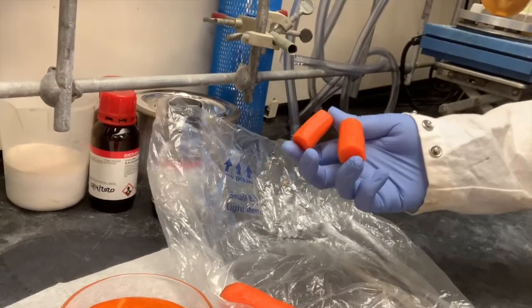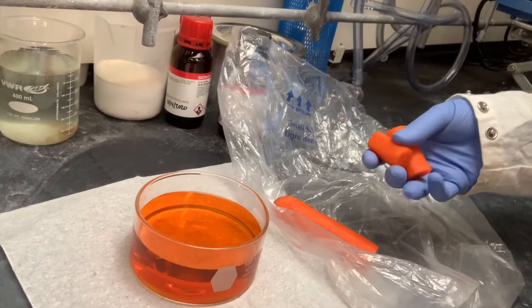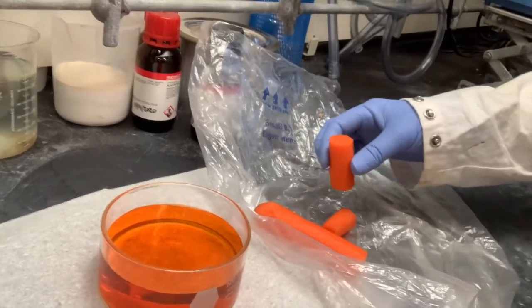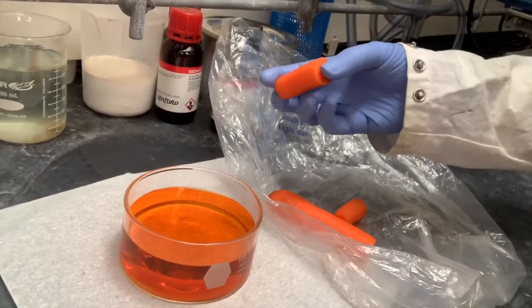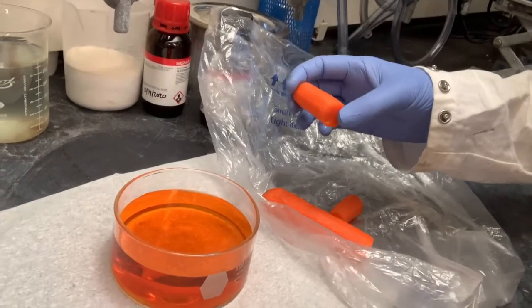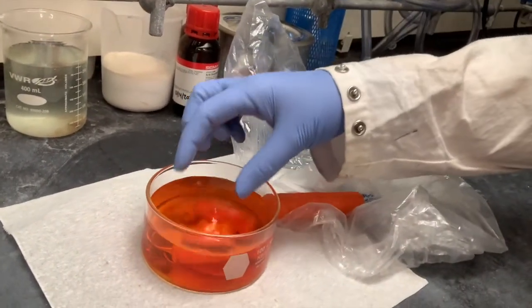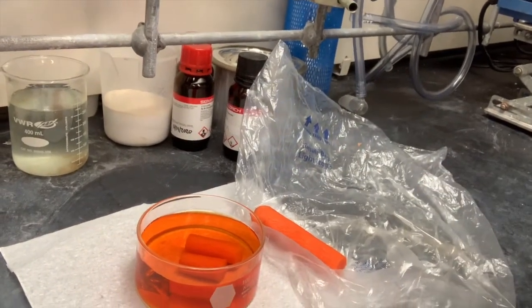Then I have these 2 pieces of carrot, and I have a solution of bromine and water, just like I showed you guys on the board. First off, notice that both are orange, just so that we realize that we're not dyeing anything. We're actually doing a chemical reaction. So to start off, we have both things as orange, and I'm going to submerge these pieces of carrot and leave them for about an hour. We'll leave this guy out of the bromine water. It is 9:15 in the morning, so I'll see you guys at 10:15.